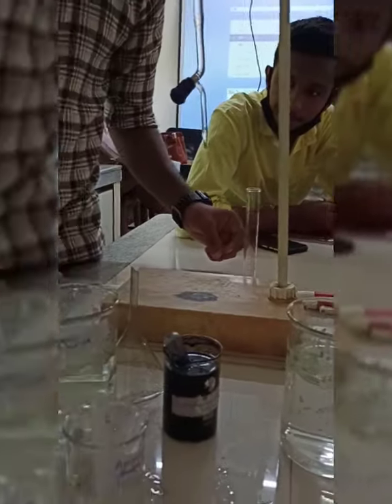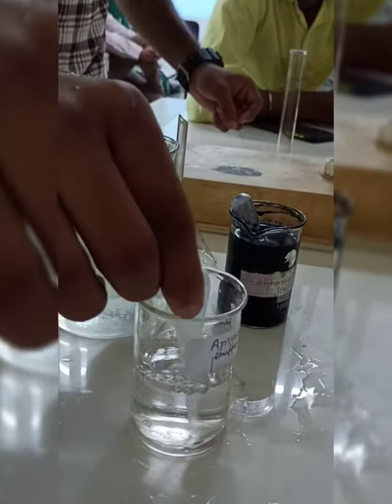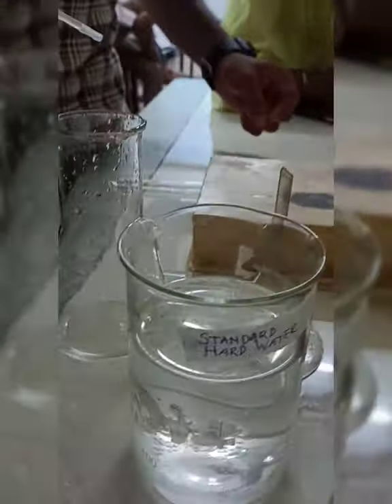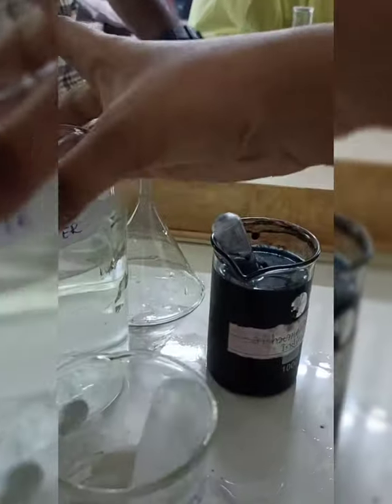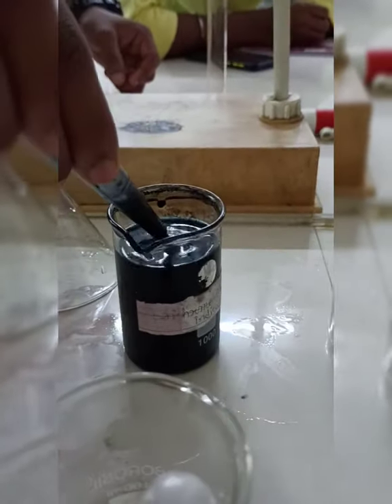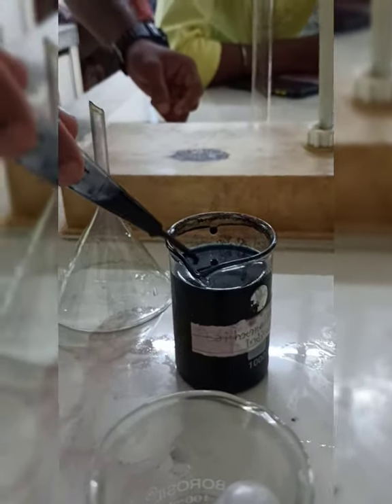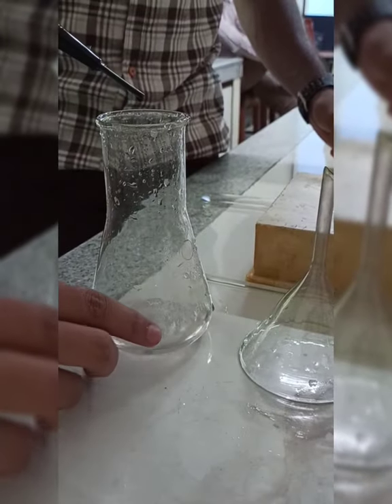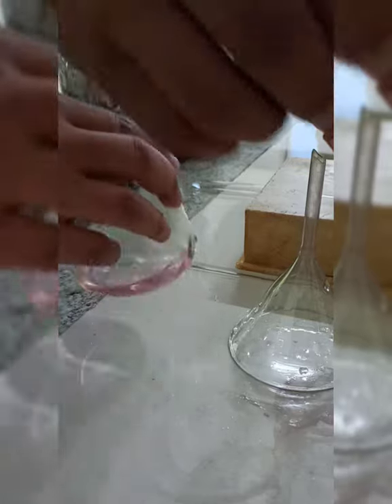Now putting the ammonium ammonia buffer to maintain the pH at which EDTA will work. The EDTA is already in the burette. Now putting EBT, Eriochrome Black T, into the Erlenmeyer flask where we have the unknown water sample. It has turned the color to red wine — please note that.